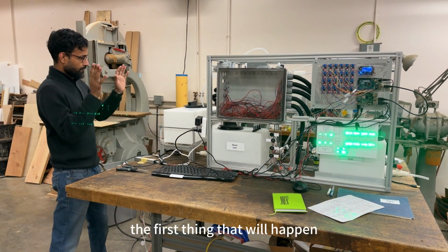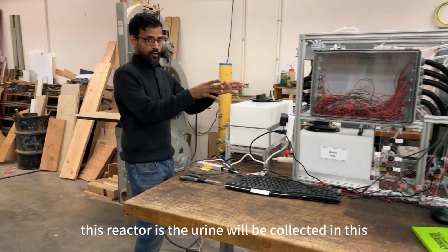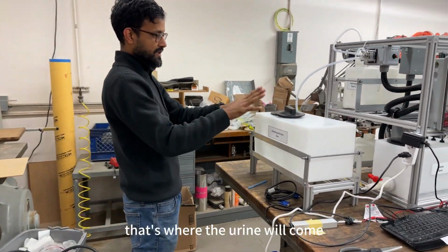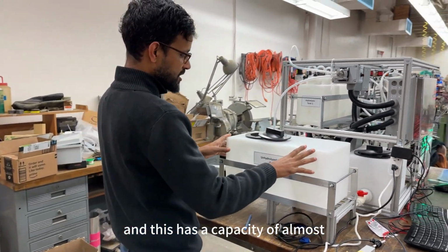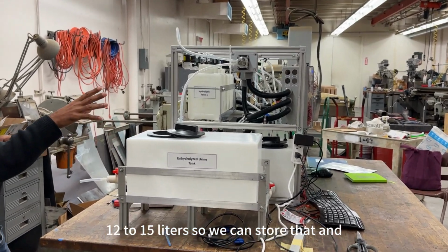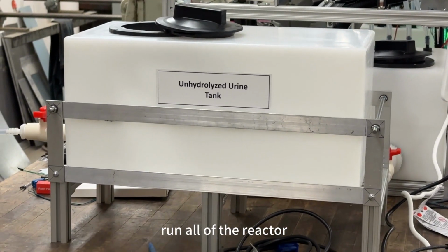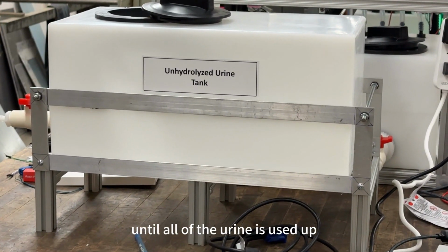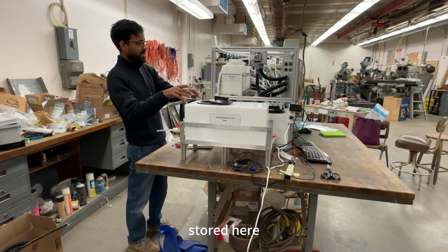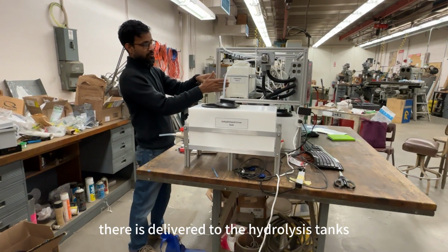In our workshop, I'll point out some of the main features here. The first thing that will happen in this reactor is the urine will be collected in this unhydrolyzed urine tank. That's where the urine will come, and this has a capacity of almost 12 to 15 liters. So we can store that and run the reactor until all of the urine is used up. Once the urine is stored here, it's delivered to the hydrolysis tanks.